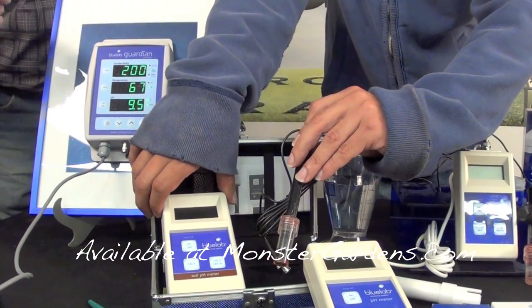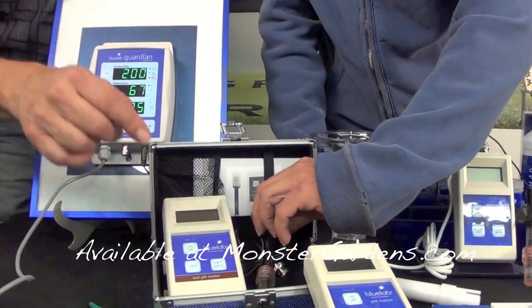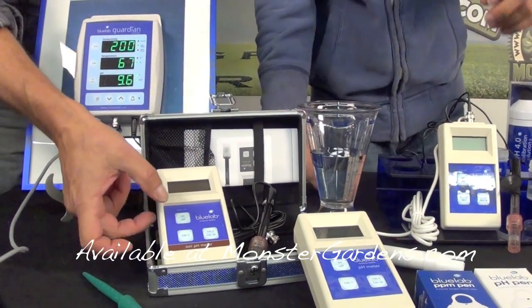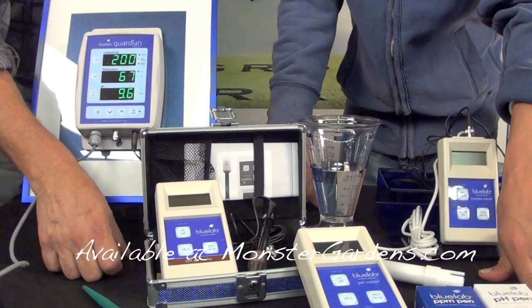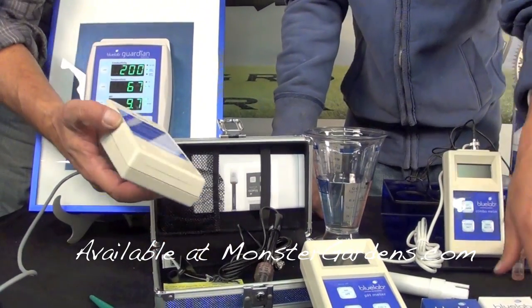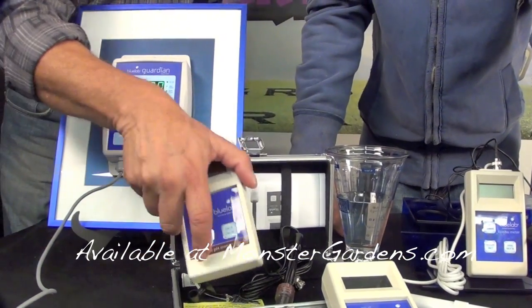Calibrate it once every 30 uses. Put it inside the hole, go get yourself a beer — that gives it about five minutes to take a reading. Turn the machine on again and you'll get your reading. All Blue Lab meters turn off automatically after four minutes so you're not wasting your battery. Our meters also come with waterproof instructions just in case you lost the box.